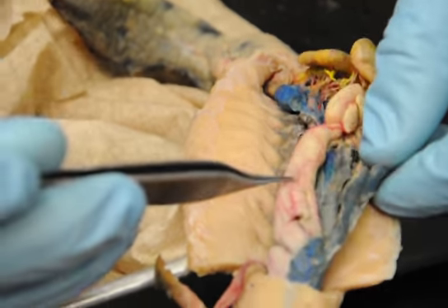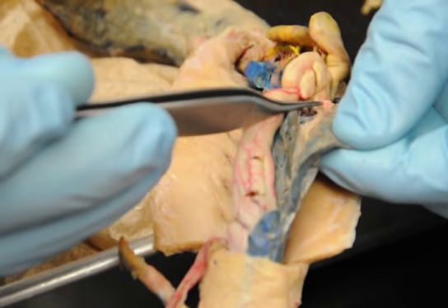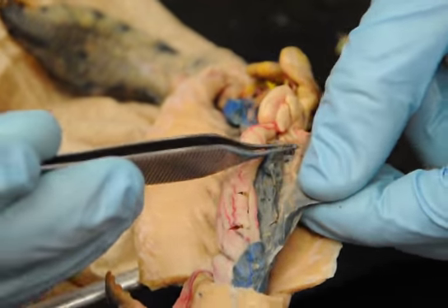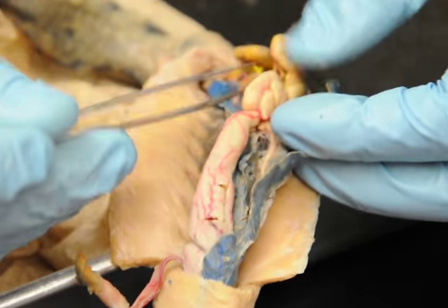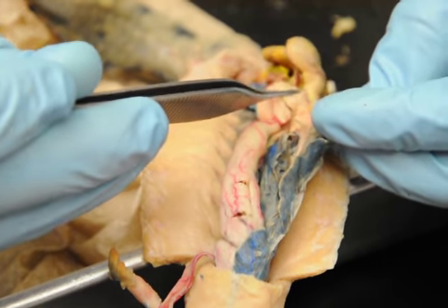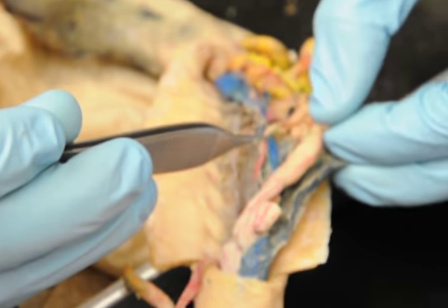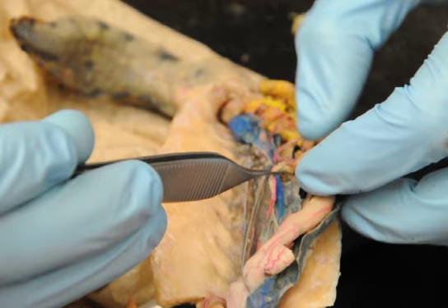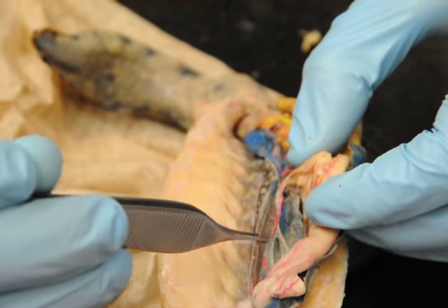Okay, so with the hepatic system, you've got the hepatic portal vein that goes through the liver here. Most of the Mudpuppies this semester are really dull colored. It's supposed to be bright yellow coming through here. That branches into two, so the one we already went over is the mesenteric. The other branch makes a right turn through the pancreas and joins the splenic artery. Of course, it's not called the splenic vein. It's called the gastrosplenic vein, but it's right alongside the splenic artery going to the spleen.